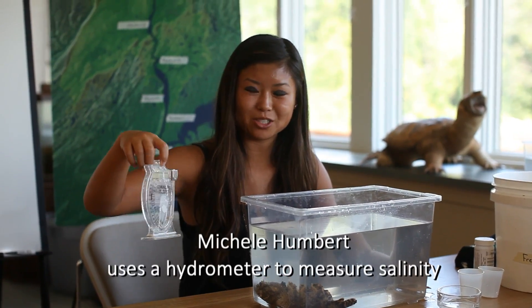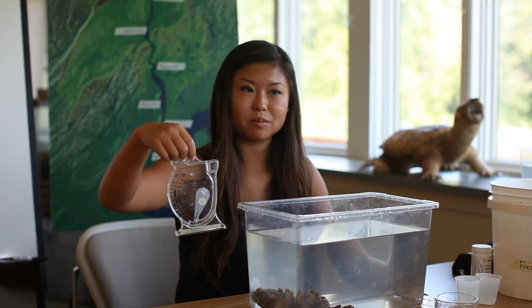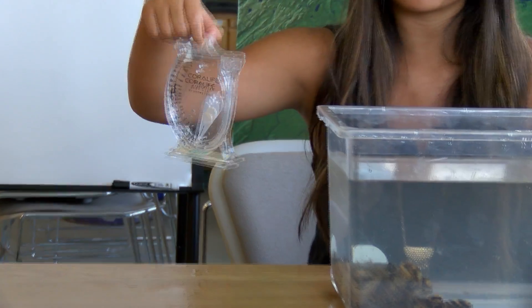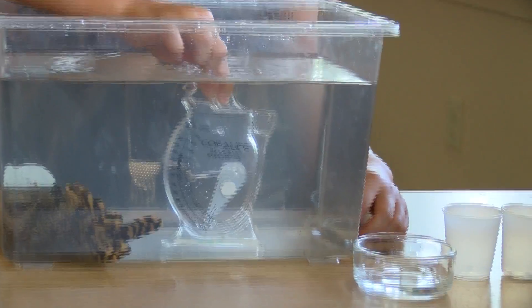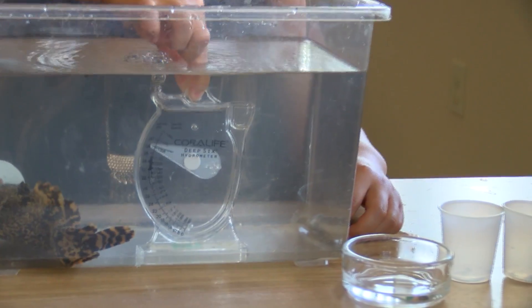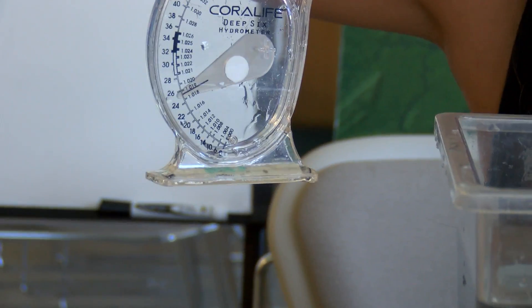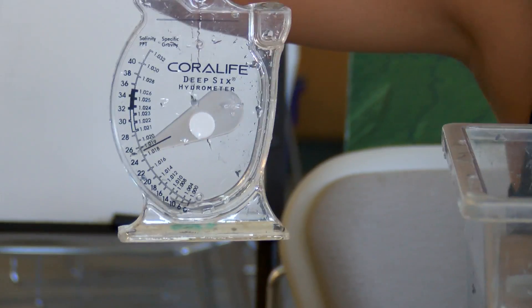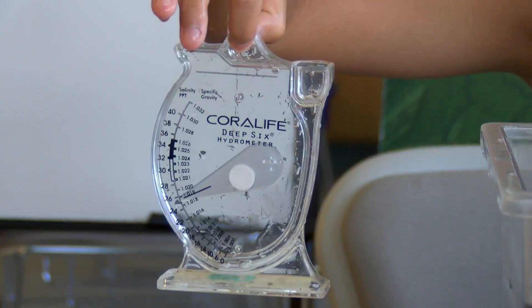Now we're going to measure salinity using a hydrometer, this little plastic instrument, which can be found at any local pet store — it's pretty cheap. First we're going to dip it into the water and figure out how much salt is in it. You want to wait for all the bubbles to stop, then gently take it out and tap it. What we have today is about 24 to 25 parts per thousand, so it's not exactly ocean water, but it's not exactly brackish water either.